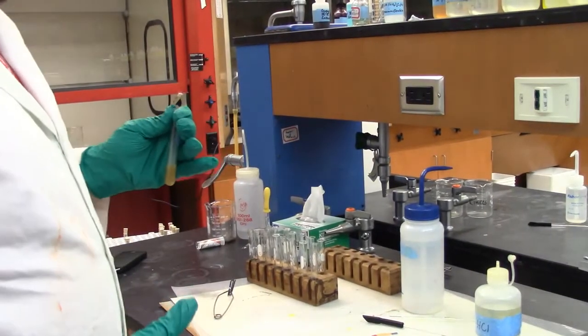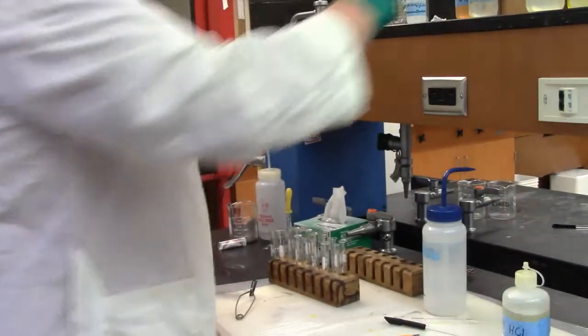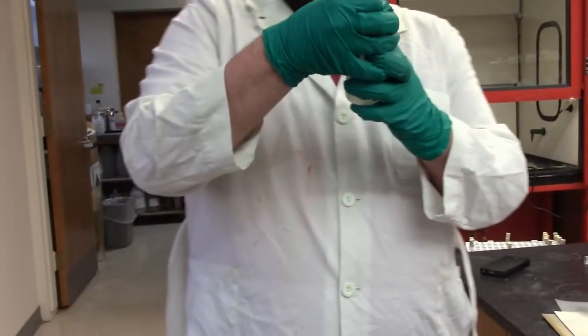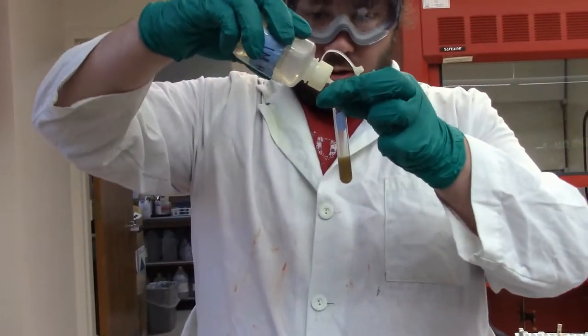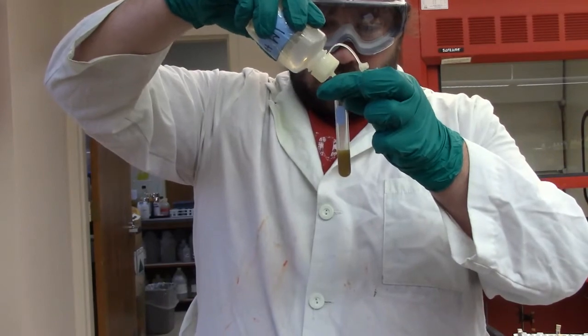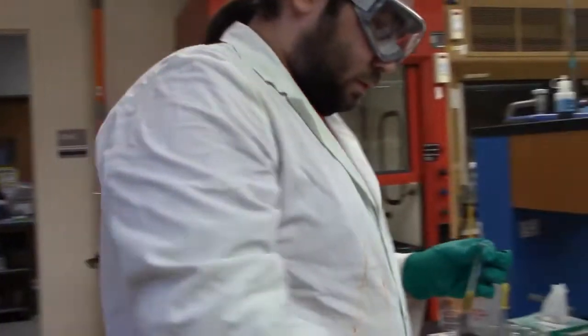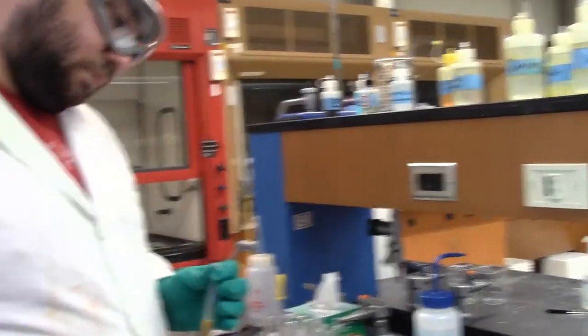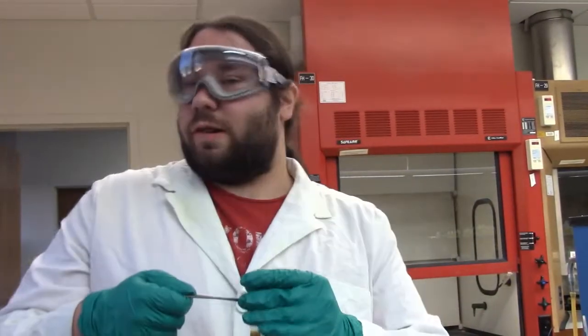So now I'm going to add 5 drops of our thioacetamide, our favorite reagent that just keeps popping up in this lab. And I'll heat it for 2 minutes. I'm not going to actually mix it. I'm going to heat this, do the rest of step 11, and I'll show it to you when it's done so you guys can decide for yourselves whether or not we have tin.